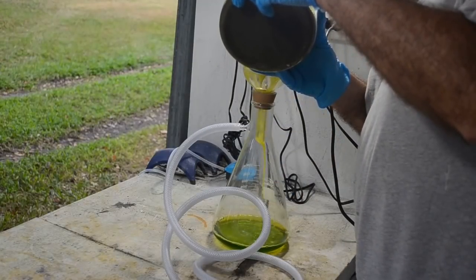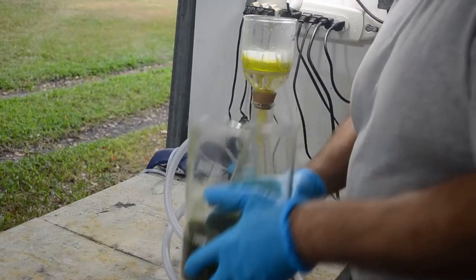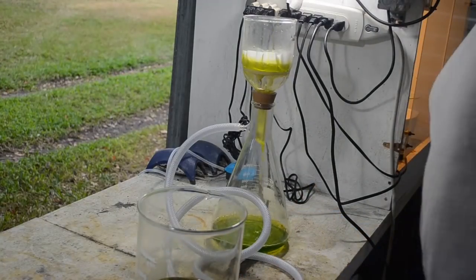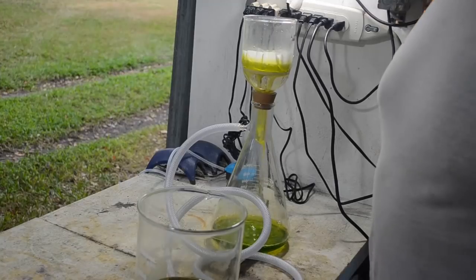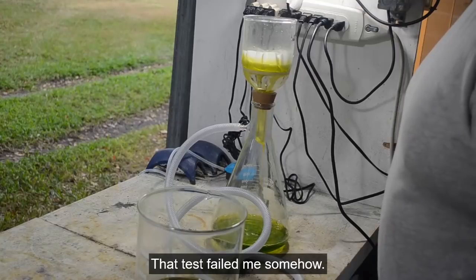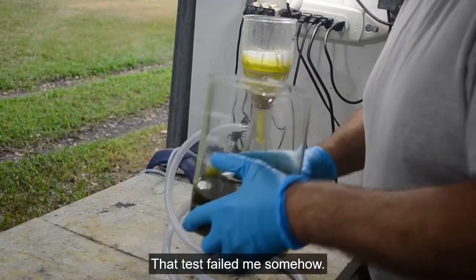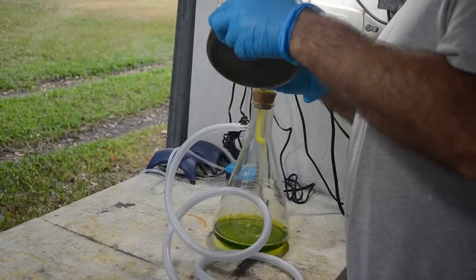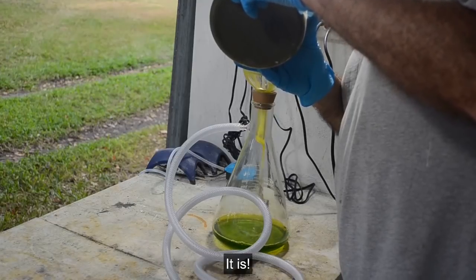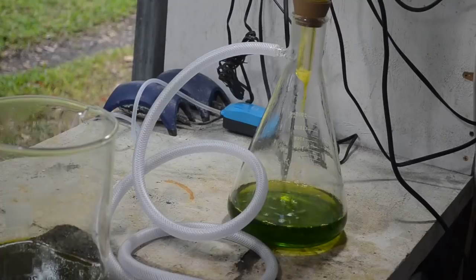It looks like it's coming off nice and clear, too. I mean, it's even pouring out of here nice and clear. There's not a lot of cloudiness to it. Well, I did the test earlier for silver nitrate content, and there really wasn't much in the way of silver present, so I don't have to worry too much about silver chloride, I'm hoping. Hopefully that's not famous last words. Come back to bite me later, but we'll see.